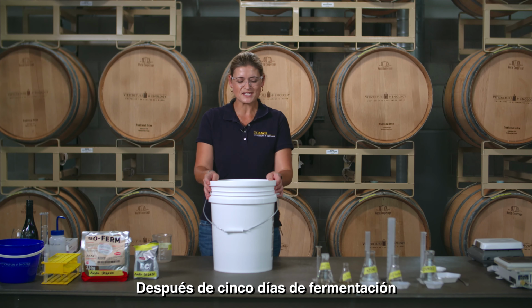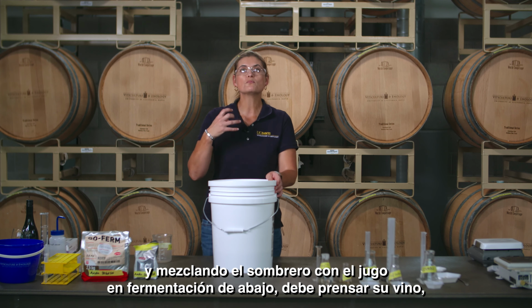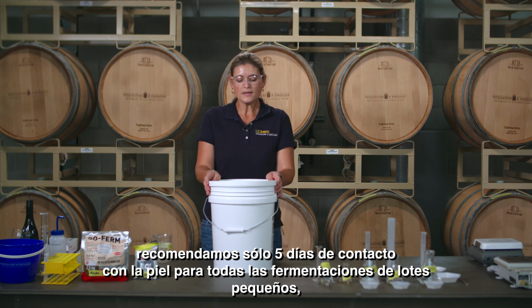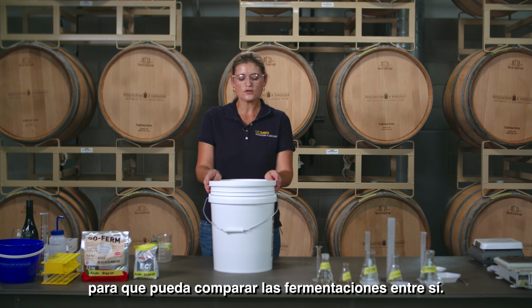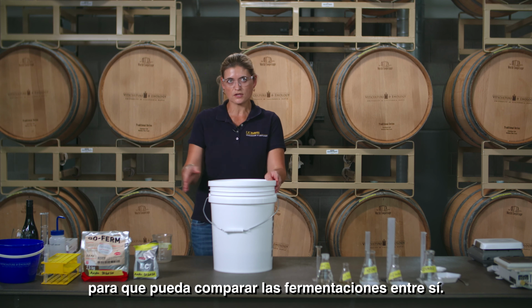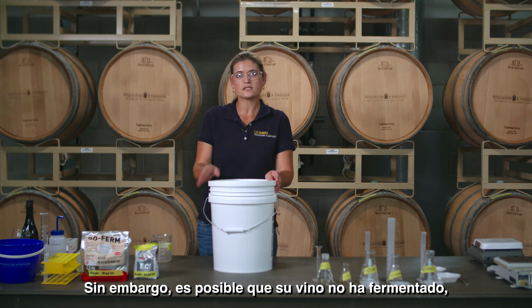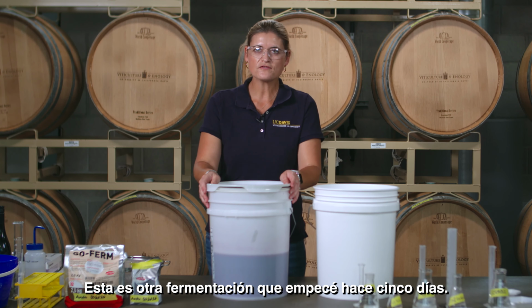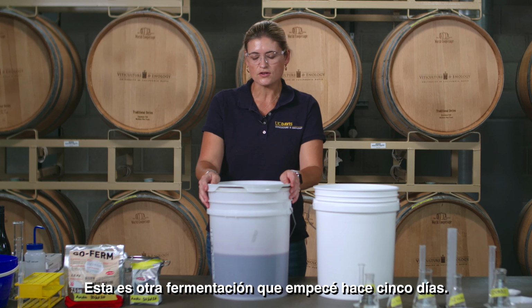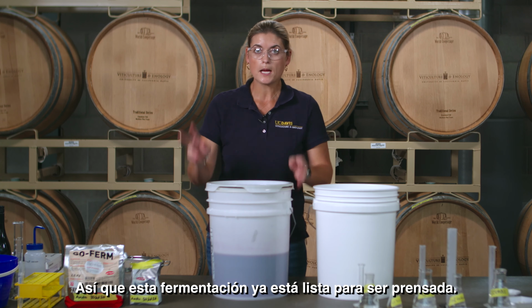After 5 days of fermentation and mixing your cap with the fermenting juice below, you want to press your wine. We recommend only 5 days of skin contact for all small lot fermentations so that you can compare your fermentations with each other. However, it is possible that your wine hasn't fermented dry, that is 0 Brix or less than 2 grams per liter of residual sugar. This is another fermentation I started 5 days ago. So this fermentation is now ready to be pressed.